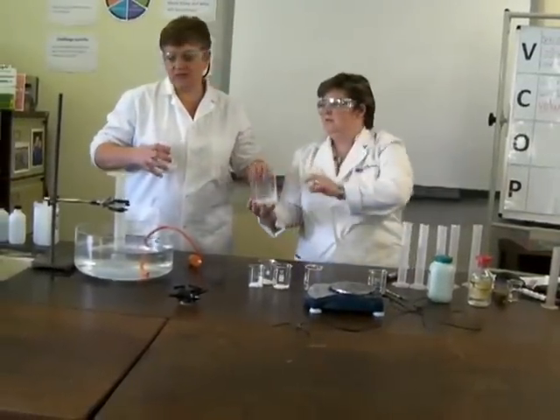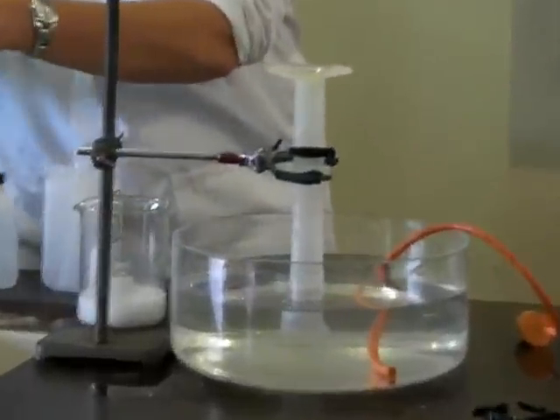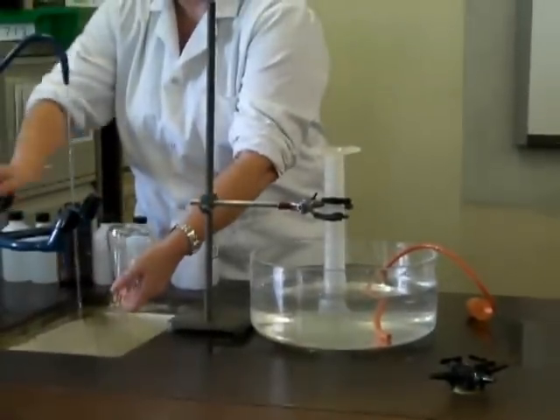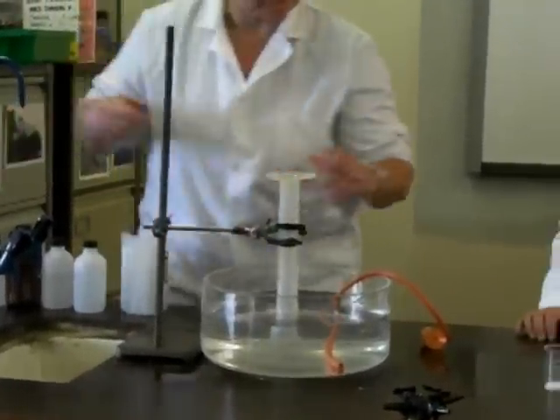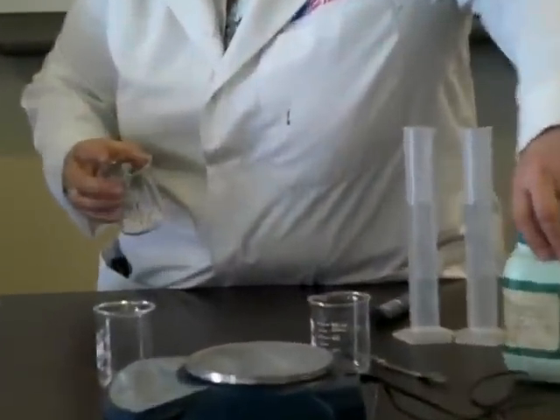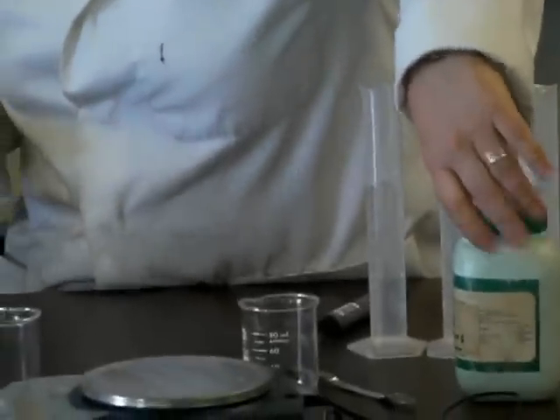Now, to save the chips going down the sink and blocking my sink with some acid, I'm going to pour it into a beaker and I'm going to wash it out. Again, I don't want any spare acid and I don't want any particles of marble chips left behind. That won't be a fair test. Okay, so our third beaker again of our marble chips in a container that says small, between 2 and 4 millimetres.